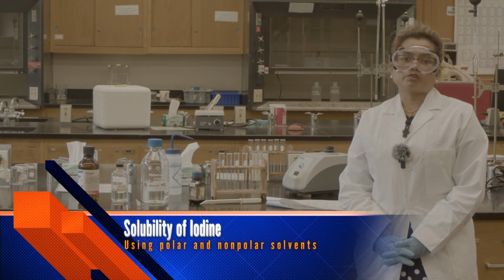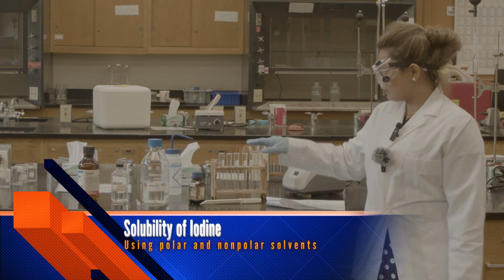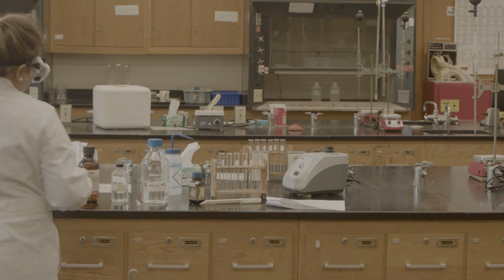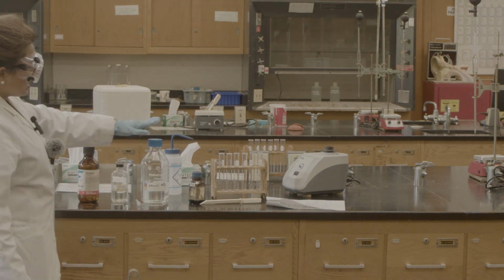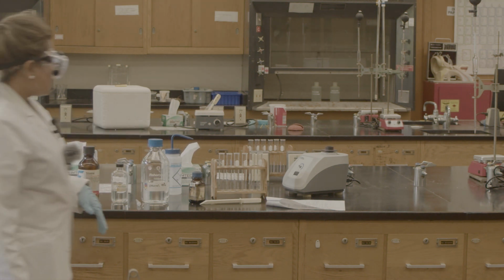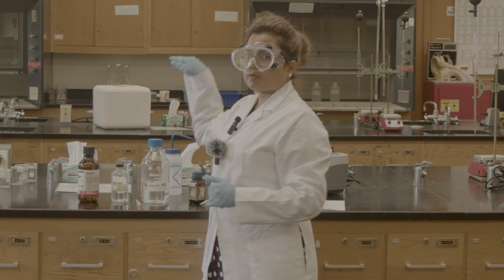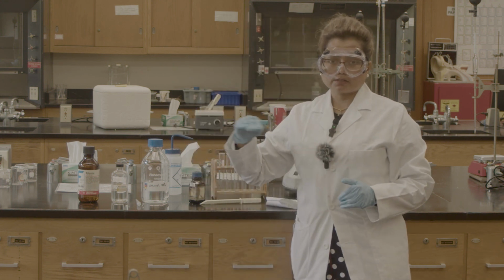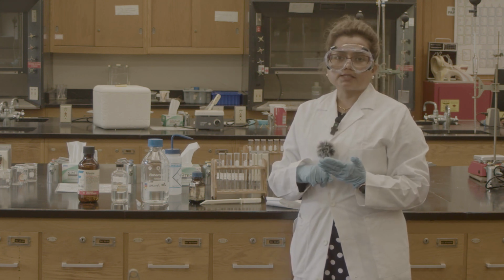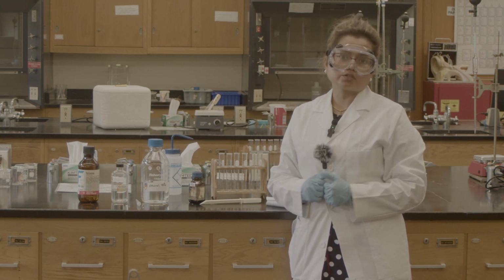In group 3, we are trying to compare the solubility of iodine, the crystal iodine, in different solvents. So what do we have for this experiment? We have water, we have ethanol, which is alcohol, chloroform, and toluene. In this experiment we are starting from the polar and going to the non-polar. Iodine, we know, is non-polar. We are trying to see how polar and non-polar solvents affect its solubility.